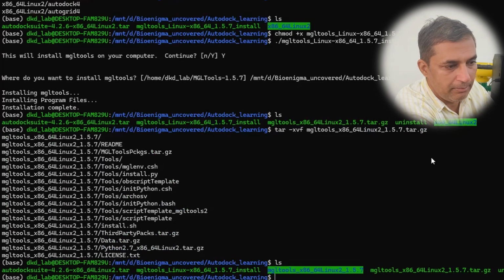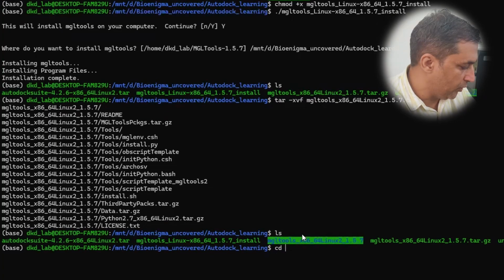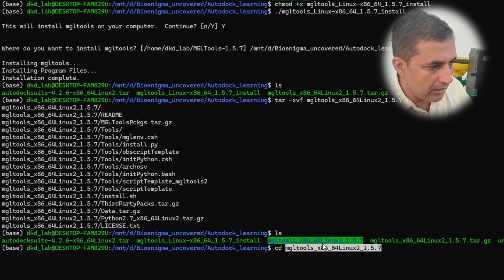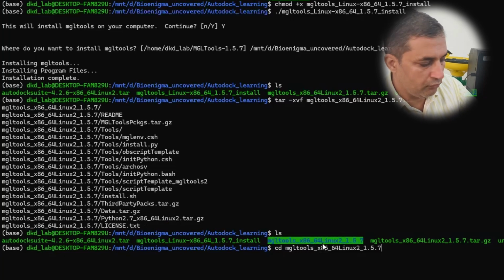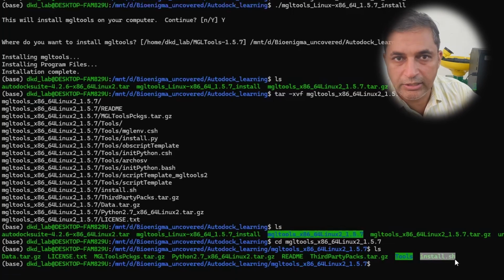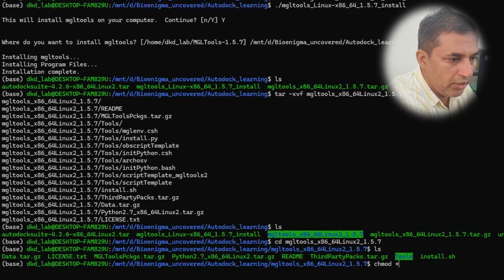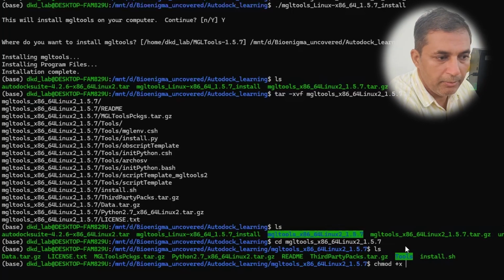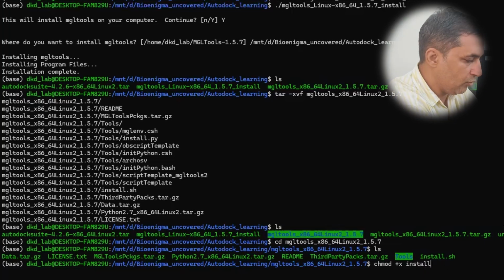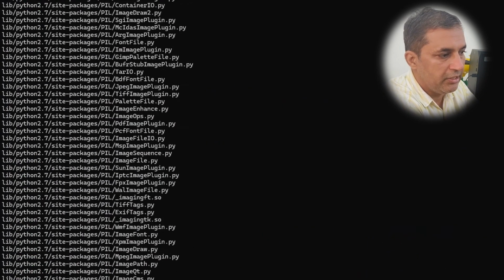Again, I'm going to hit the ls command, and you can see this is the folder MGL tools. So I'm going to type cd, copy paste the folder name here, MGL tools, hit the enter button, then I'm going to type ls, and you can see here we do have an installer with a shell script command. So again, I'm going to run this command chmod space plus x, and then again a space, then we need to type this file name install.sh, and continue with the command dot forward slash followed by the file name install.sh.